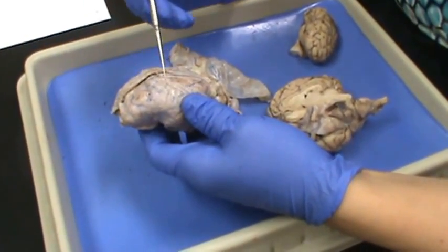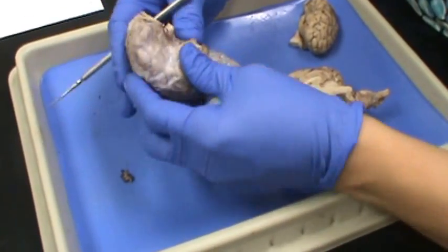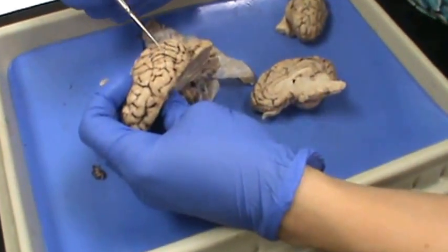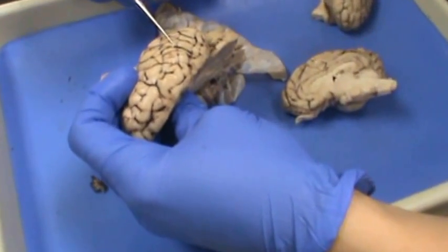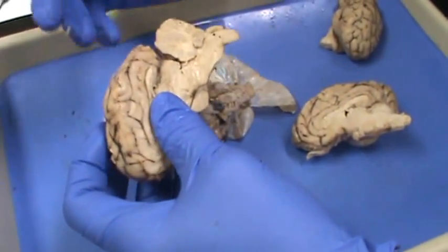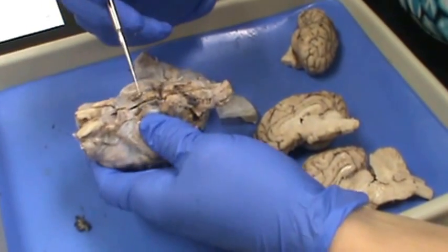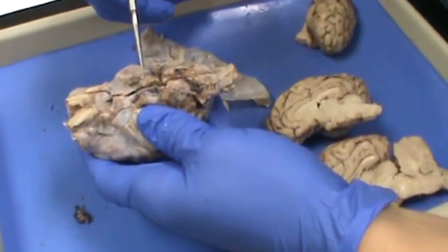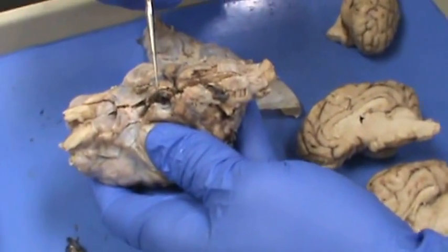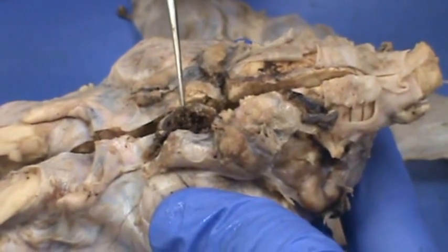It's real tough. Then you have the arachnoid mater. The arachnoid mater is going to be all of these brown stringy things in the arachnoid space. You can see that they're concentrated around the pituitary gland here, with the brown strings around it — very concentrated. So that's also arachnoid mater.